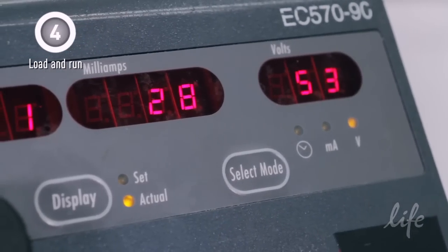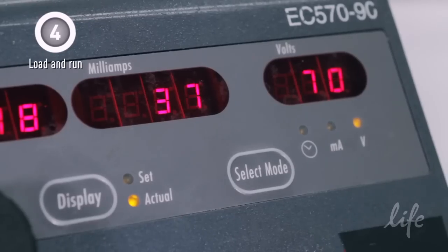Bolt gels are optimized to run in 35 minutes for MES buffer and 45 minutes for MOPS buffer.